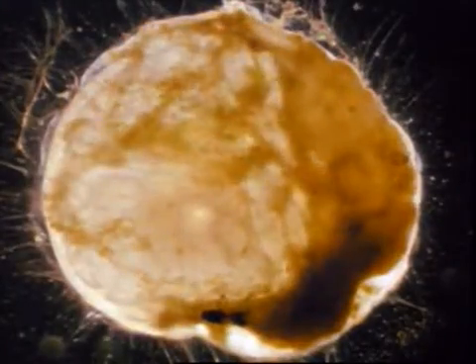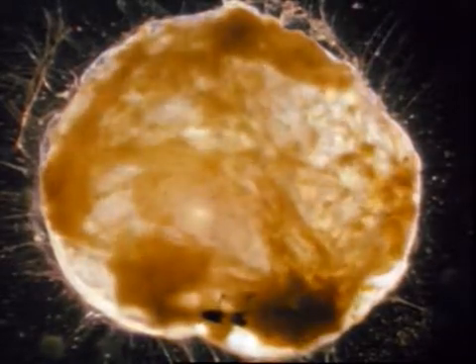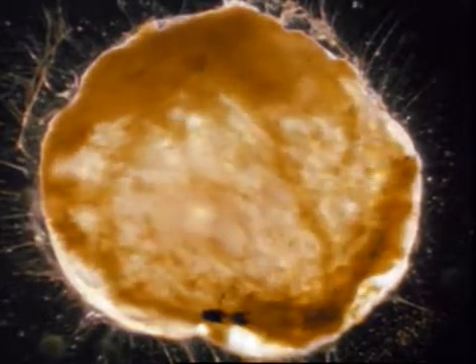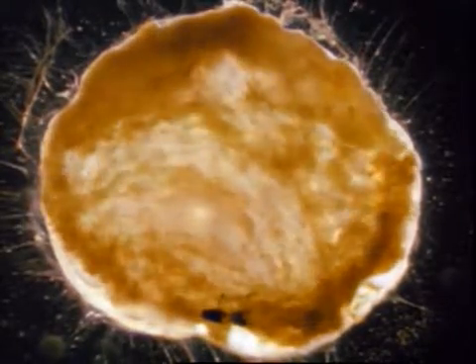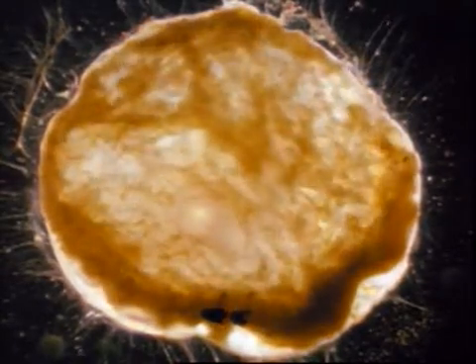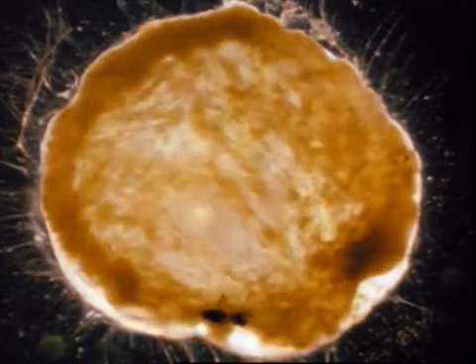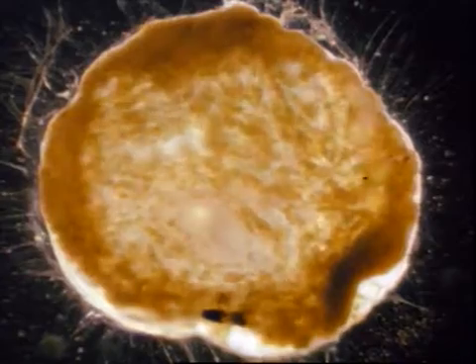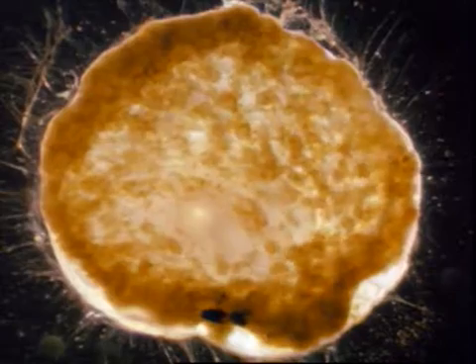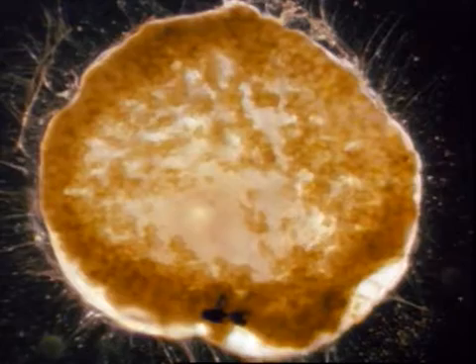Here, the multiple fission of a megalospheric Heterostegina on the side of the test facing the substratum. The emerged protoplasm mixes by lively streaming and then divides into the spherical daughter cells. Embedded in symbiont-bearing residual protoplasm, they cover most of the test surface.